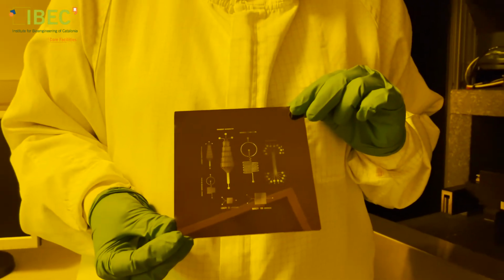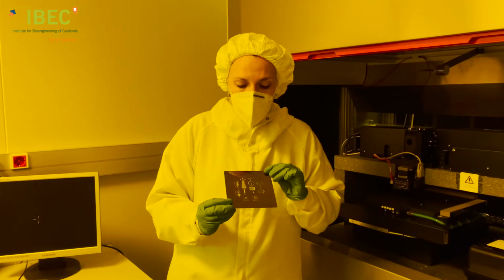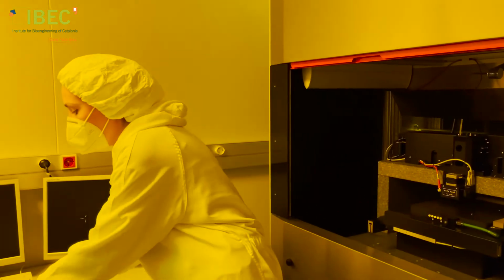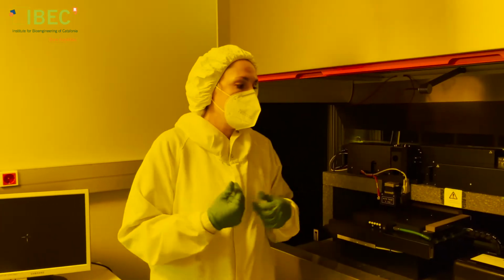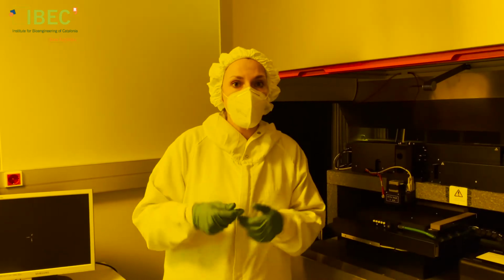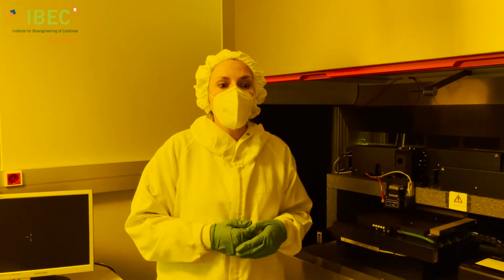This is a mask fabricated here with different microfluidic patterns. And as you see, it creates parts where light is blocked and parts where the light is passing. We use this machine to create these masks because they require high precision, and this machine can go down to 1 micron. However, it takes a lot of time, so we use it only for the fabrication of masks. And like this, with a single mask, we can replicate this design in different substrates by the next technique that I will explain later, and that is much faster.